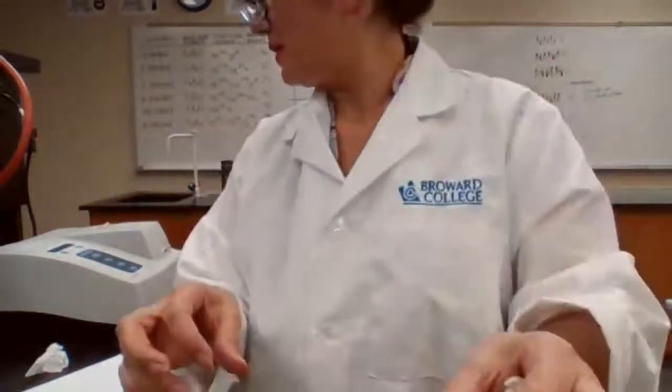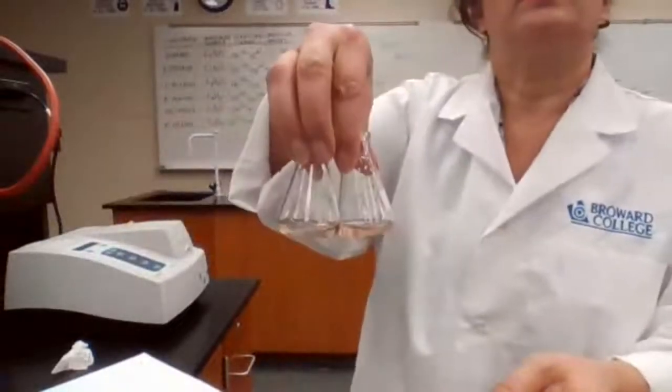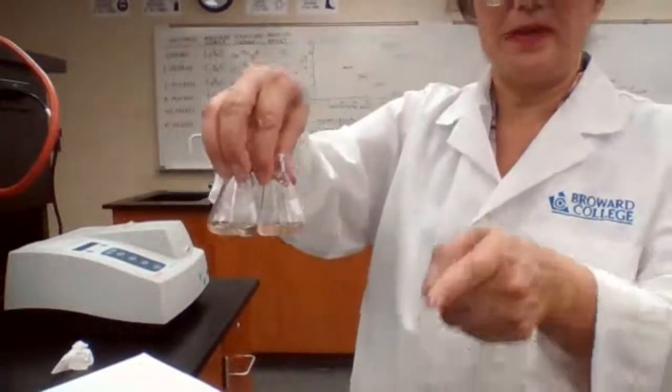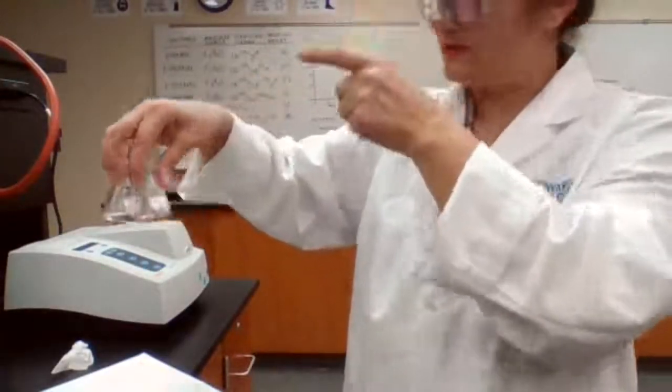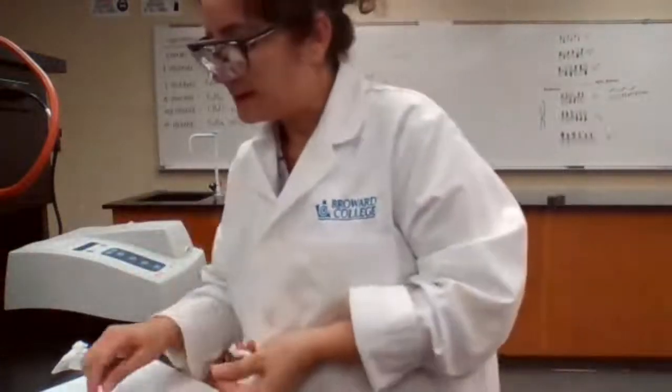So this should have higher absorption also. A has higher concentration, B has lower concentration. Looks like A is out of the range of our calibration also. It's too dark compared to all the solutions that we had already. So in your calibration curve, it might be like an outlier, higher than every other sample that you had.